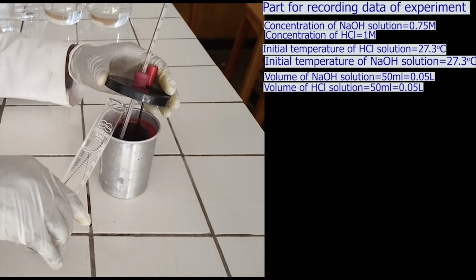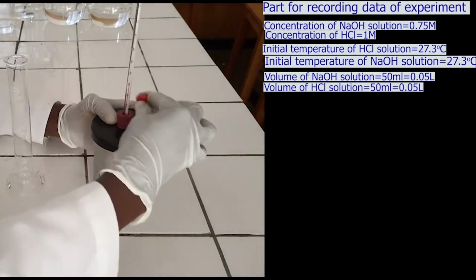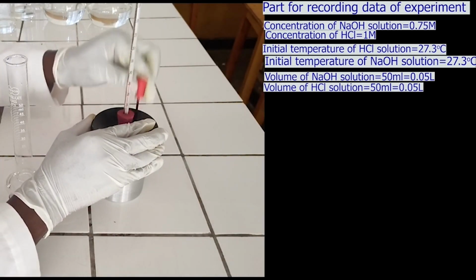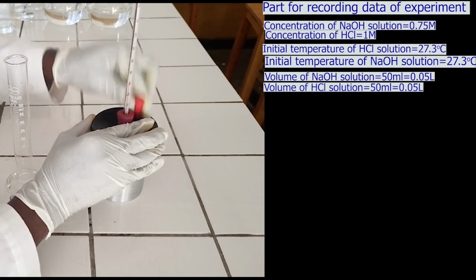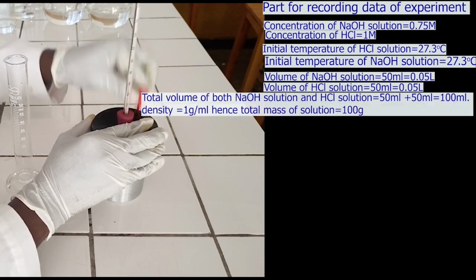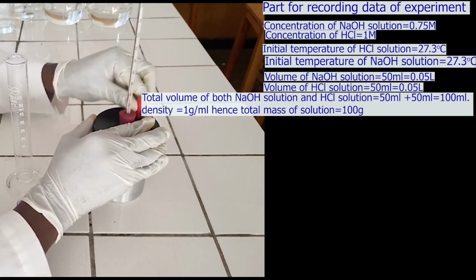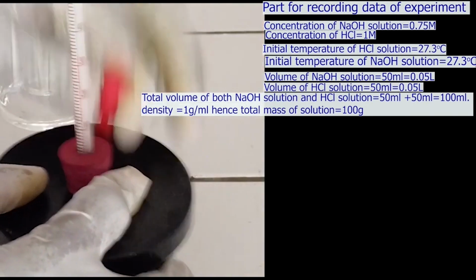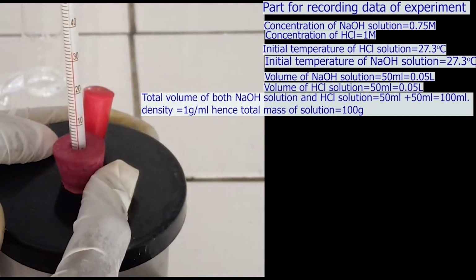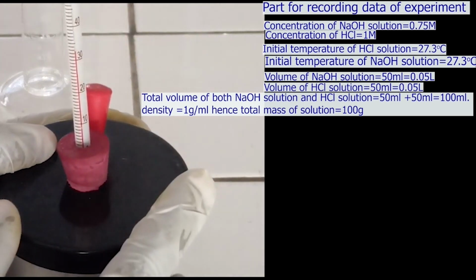After measuring, quickly pour 50 ml of hydrochloric acid solution in the cup calorimeter, and close the cup calorimeter immediately so that no heat will be lost. Stir the solutions to allow the reaction to occur fast. The total volume of solution is 100 ml. The density of solution is around equal to the density of water. Hence the density of solution is 1 gram per milliliter. By using density and volume you can deduce the mass of solution. The mass of solution is equal to 100 grams.